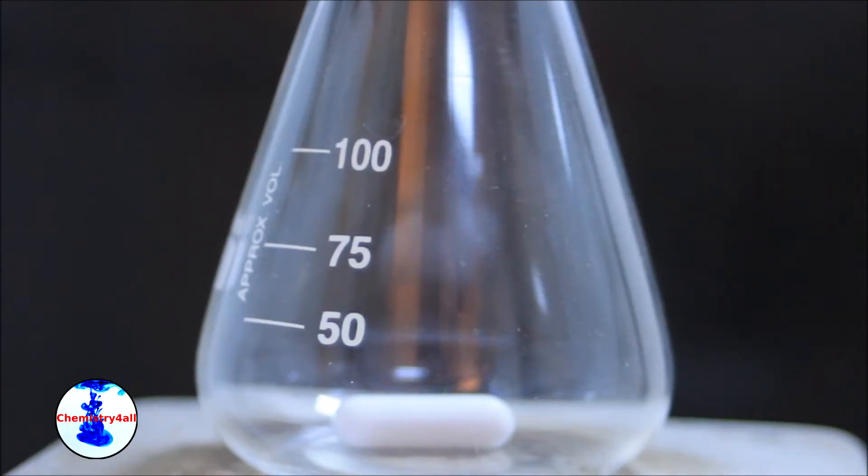First, we need to activate the molecular sieves. Despite the fact that they are supposed to be activated, they get moisture over time and so they get partially deactivated.